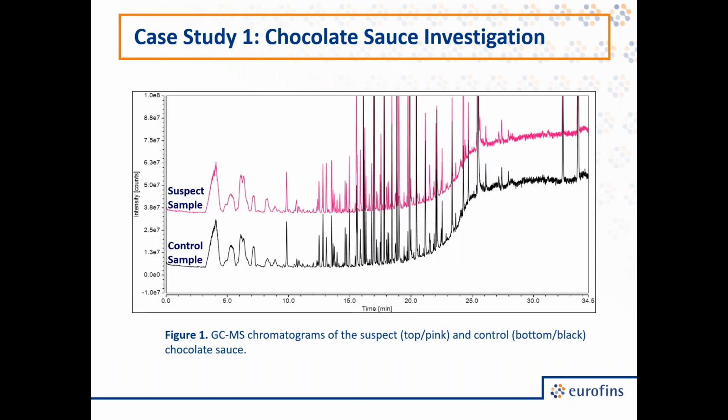So what we're looking at here is the chromatographic aromatic profiles of the two samples. So on top in pink, we have our suspect sample, and on the bottom in black, we have the control sample. And you might notice these have extremely complex profiles. There are many different volatile components that are important in creating the aroma of a chocolate sauce. So each peak here is a different component, and as Dr. Willems described, the beauty of the mass spec detection is that each of these peaks has actually been identified by the mass spec by comparing those fragmentation patterns to libraries.